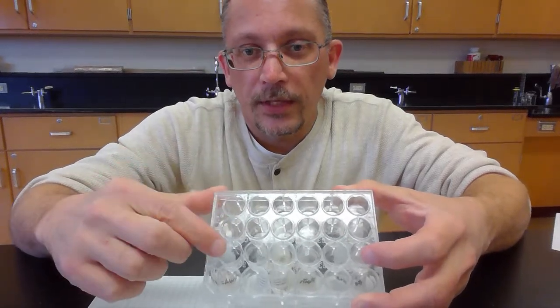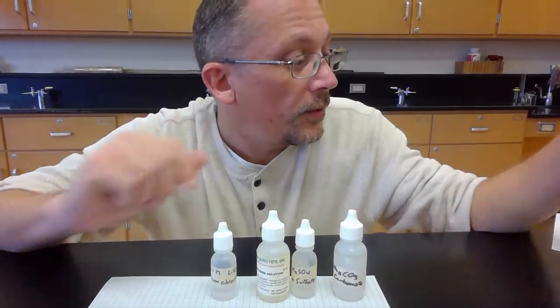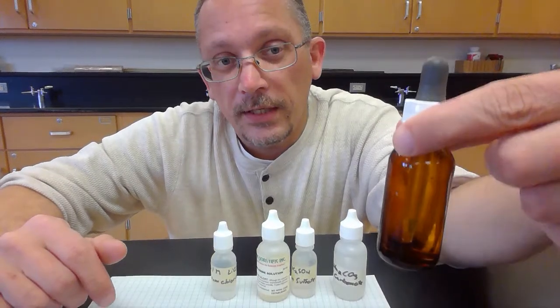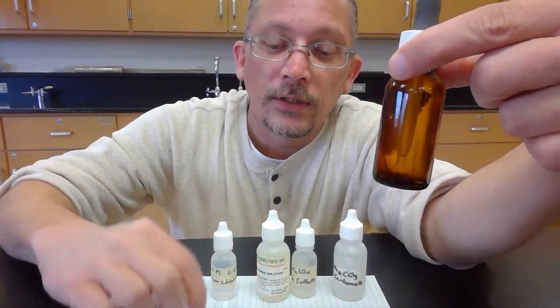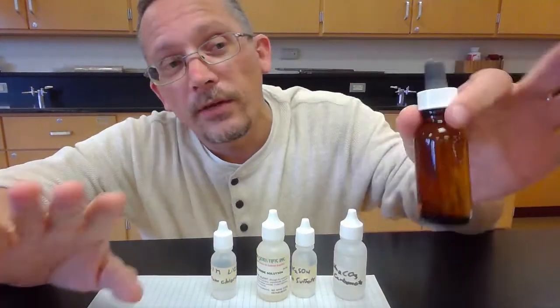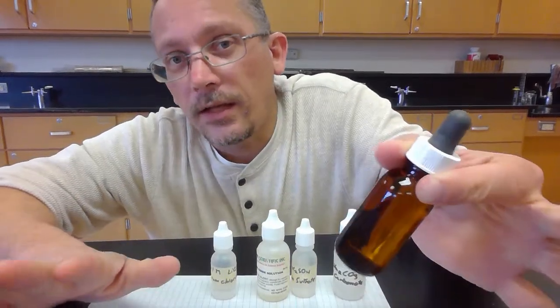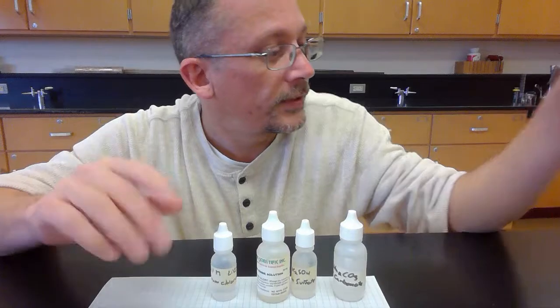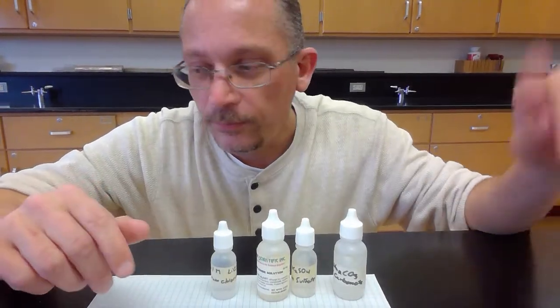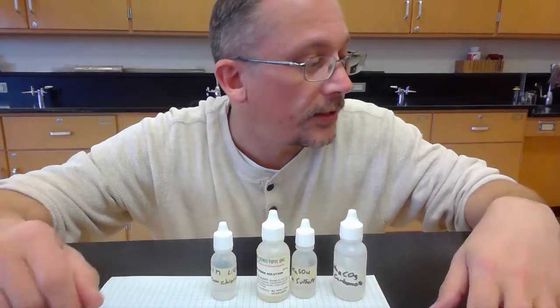I'm going to put the lithium chloride in 3 of them. I'm going to put the sodium iodide in 3 of them, and so forth, right? And then I have 3 more here. This here is some silver nitrate. We'll expose each one to silver nitrate and see how it reacts. Now, if you're working on this in the classroom, be careful with the silver nitrate. It will stain your skin, not permanently, but temporarily. I usually end up with some spots on my skin every time we do this lab. It usually lasts a week or 2, and then it goes away.